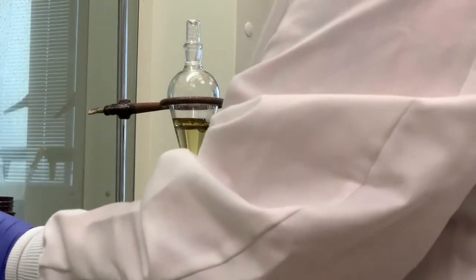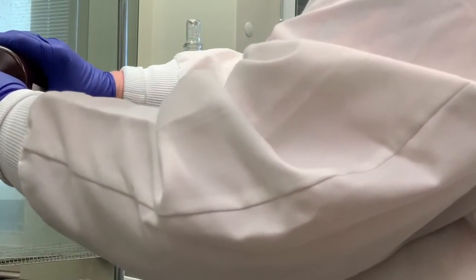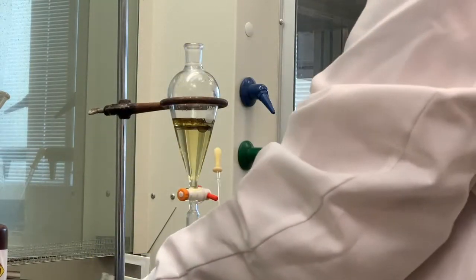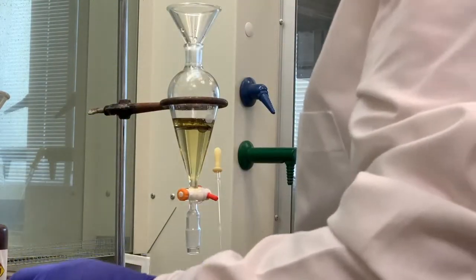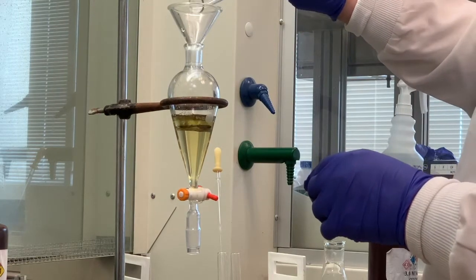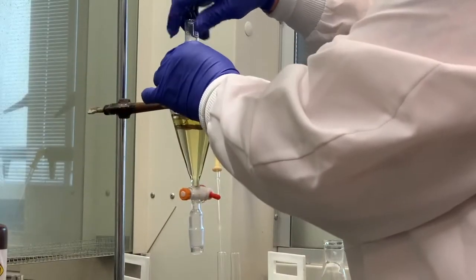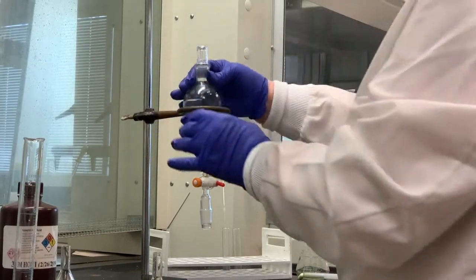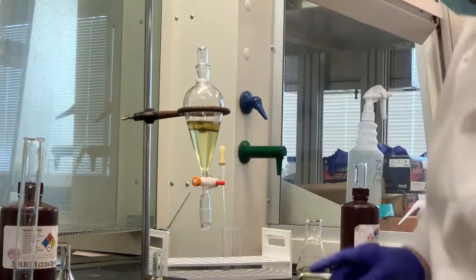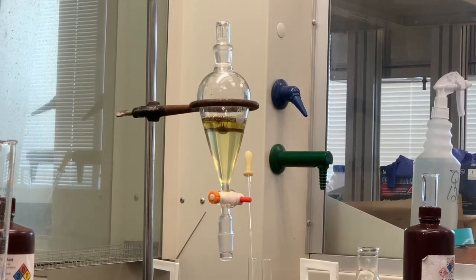I'm going to add a little bit more of the hydrochloric acid. I'm seeing a little bit of a suspension in there. Let's see if this will help take care of that. It could just be an artifact of the quality of the p-nitroaniline that we're using. It looks like it's coming from the p-nitroaniline, but I just want to see if we can take care of that. If not, it will just come through. I'm just going to let it sit there for a couple minutes and see if some of that filmy material will dissipate.